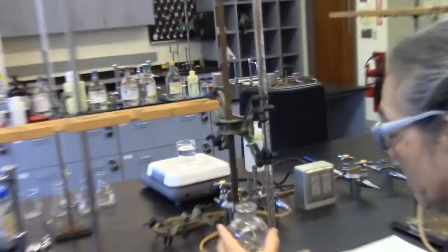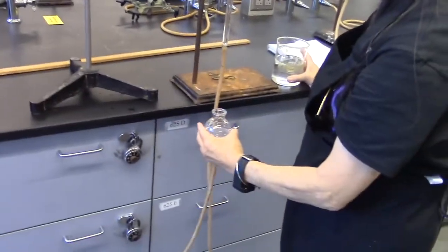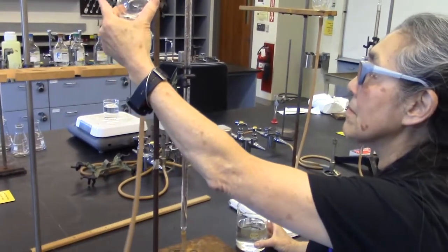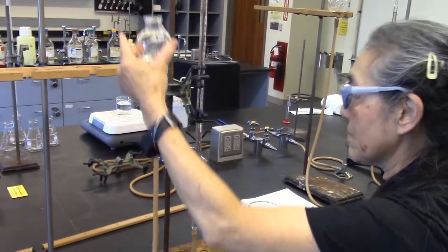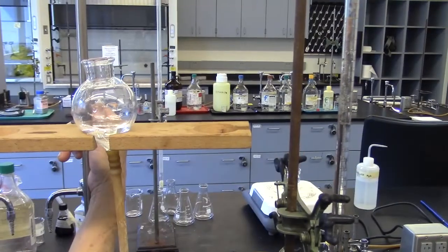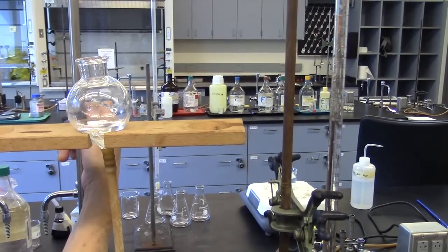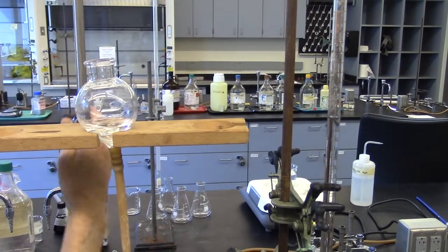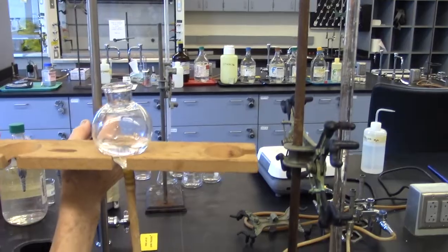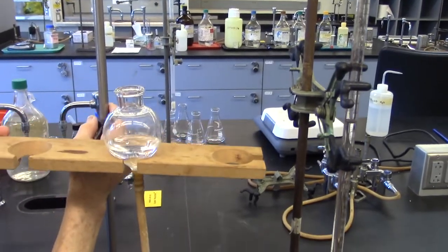Raise and lower the leveling bulb, taking care not to raise it above the top of the manometer to avoid giving everyone a shower. Once the air bubbles are removed, move the funnel support so that it is near the level of water in the manometer. 30 milliliters is an acceptable volume.